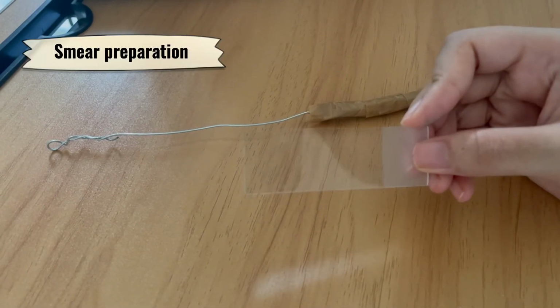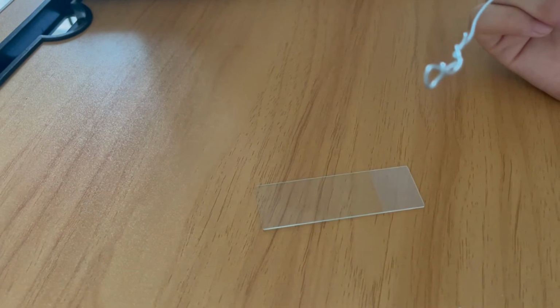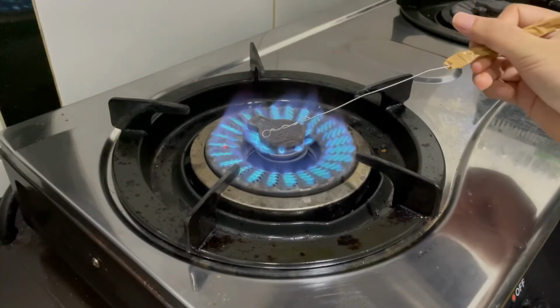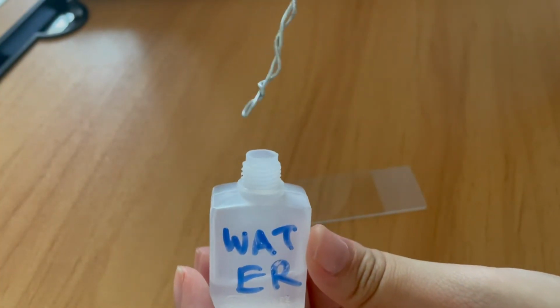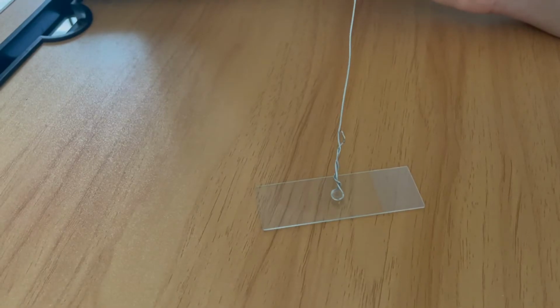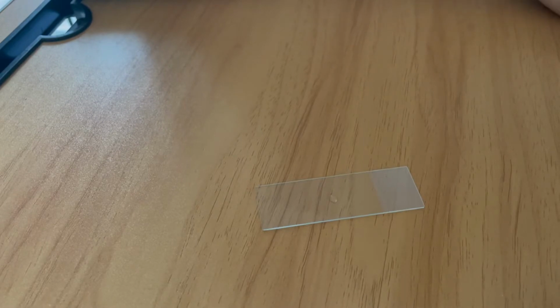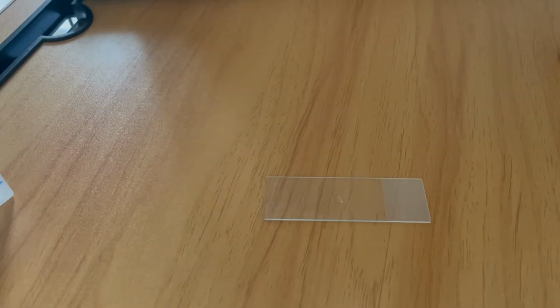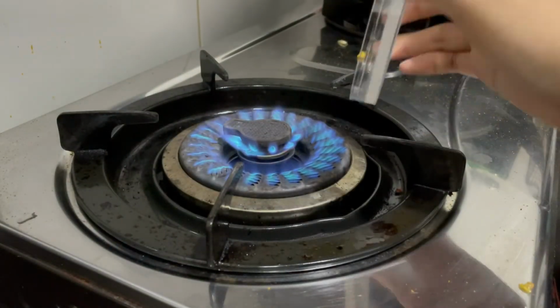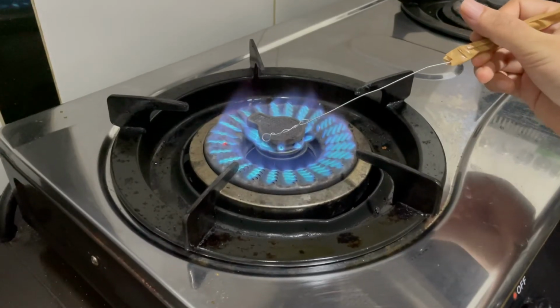The procedure will be carried out by doing a smear preparation first. Before we prepare a smear, we have to do the aseptic technique by flaming the loop in the flame and cooling it. The smear was prepared by placing a drop of water on the slide. By using aseptic technique, the organism from the culture was transferred to the drop of water.